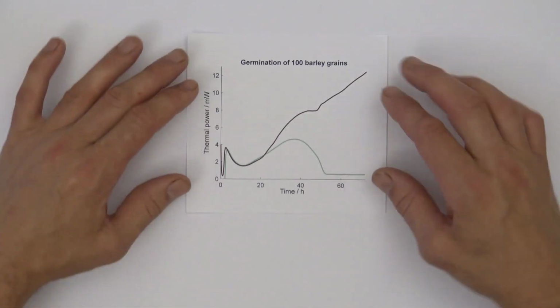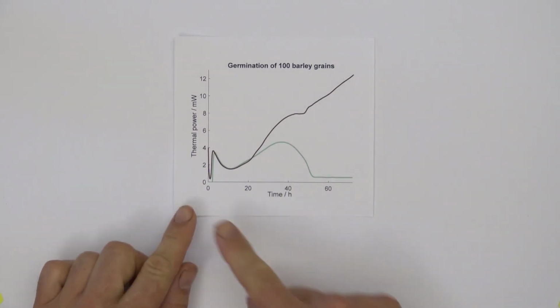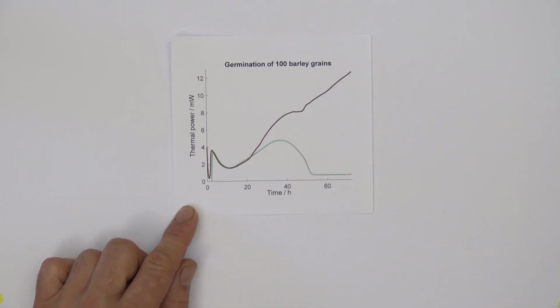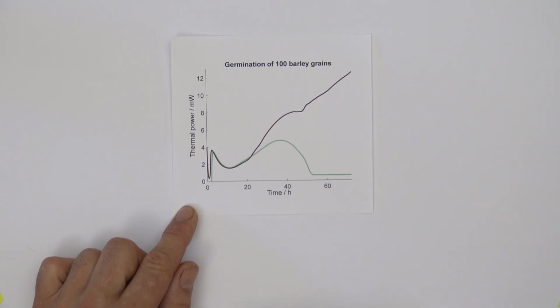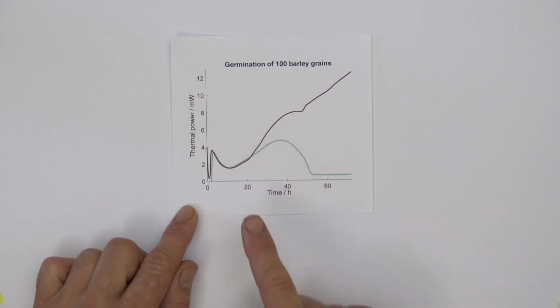We have samples of 100 barley grains, and the black curve shows nicely germinating grains with a high thermal power. This is a 3 days measurement. They have plenty of oxygen because there is gas flow through, or air flow through, the vial. The green curve shows the same type of samples, but here the aeration was not successful.